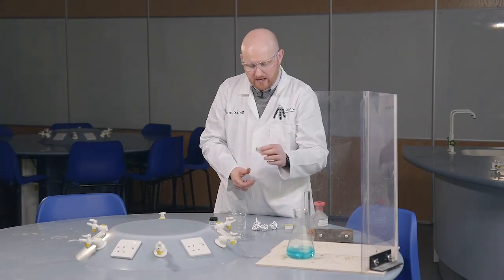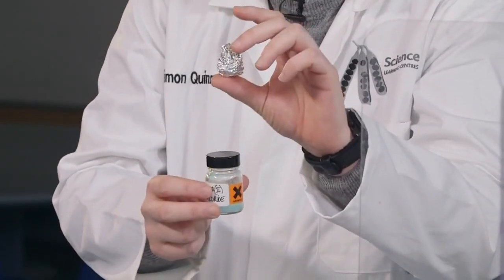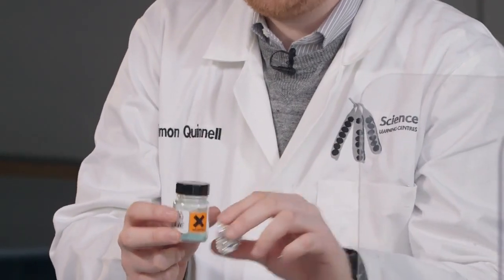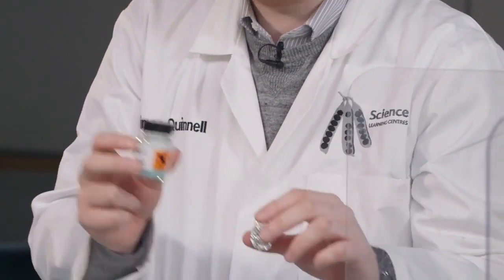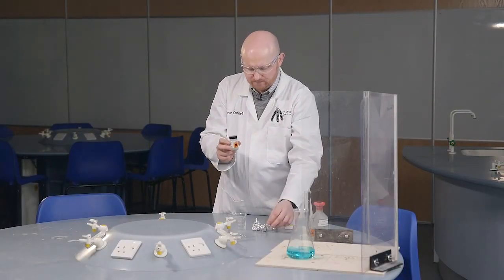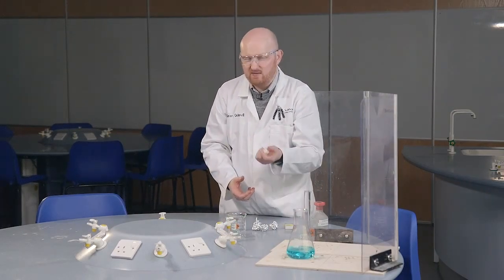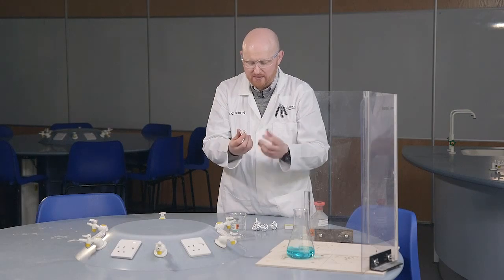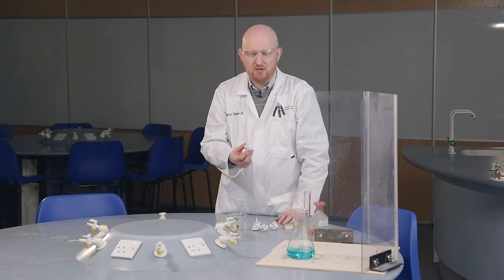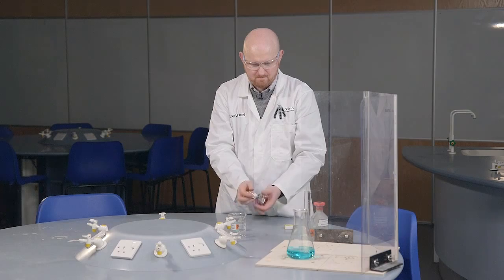Now, our aluminium is more reactive in the reactivity series than copper. So the aluminium will displace the copper out of the copper chloride, which means we'll get aluminium chloride forming and copper as a solid metal forming. And we'll be able to see that at the end of the reaction. Because we've also got that hydrochloric acid there to get rid of our aluminium oxide layer on the aluminium foil, we'll also have hydrogen being produced. Now, the hydrogen is what we're going to ignite to create our northern lights, to light the way for Santa.